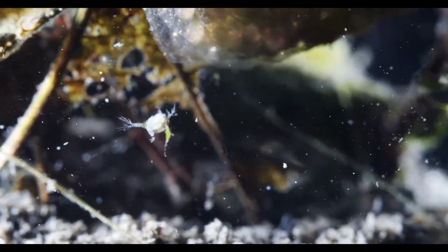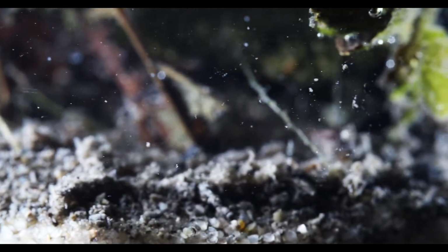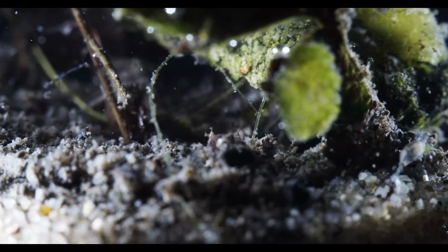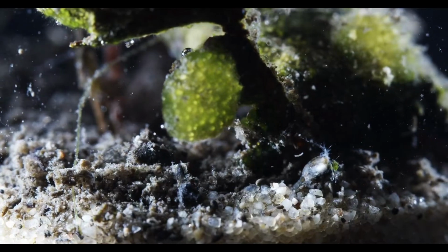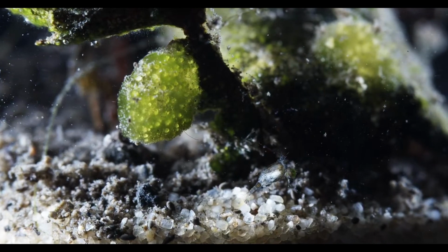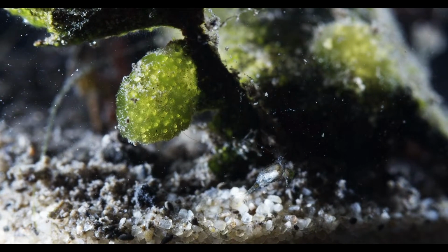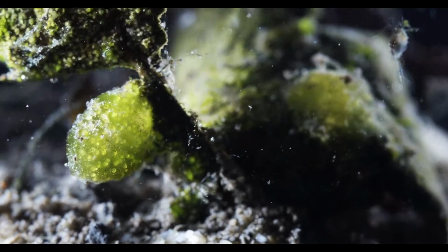This copepod is an absolute unit. I don't know, I haven't seen them as big as this. This basically is 2-3 millimeters long. Ah, nice. Had been living on tiny critters, you know?